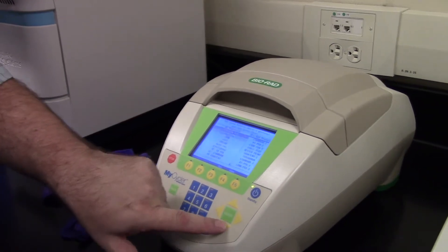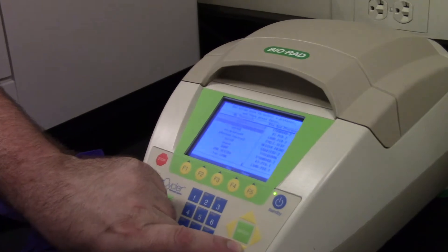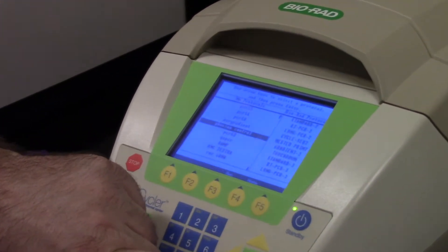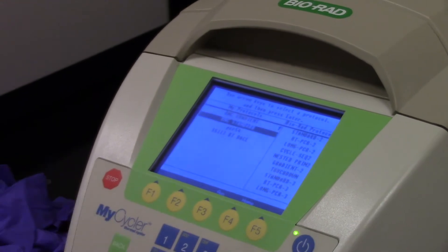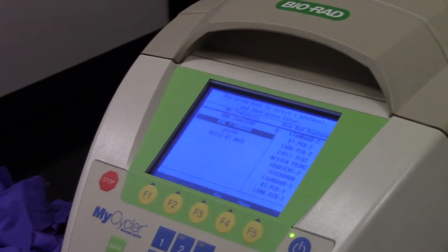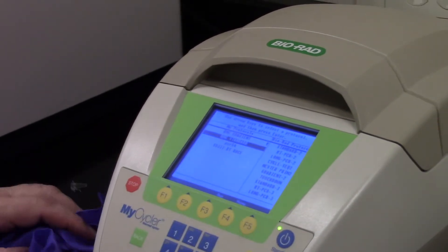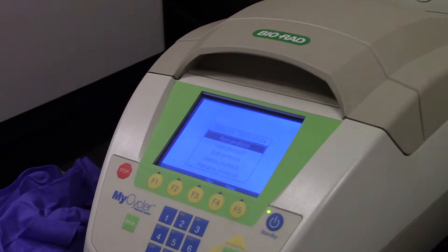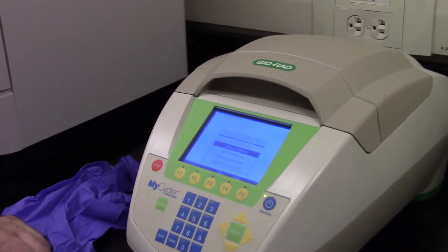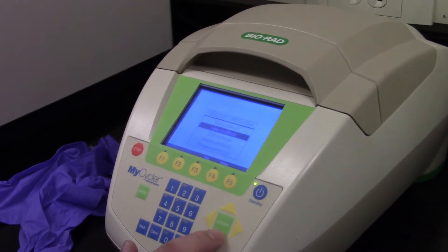I'm going to page down through these pages to find an appropriate PCR program for our PCR primers for developmental biology. I've got this one called RNC Standard for my initials. I'll hit Enter, and we would like to view what that protocol is. We could edit it, save it, or just hit Run if we already knew it was there.